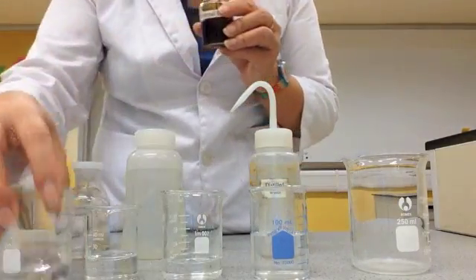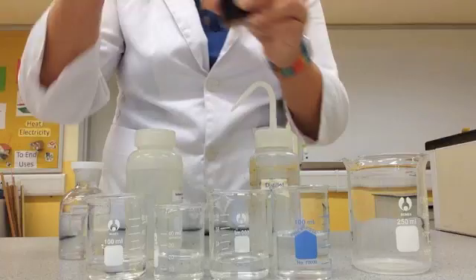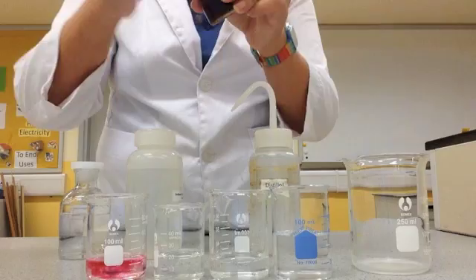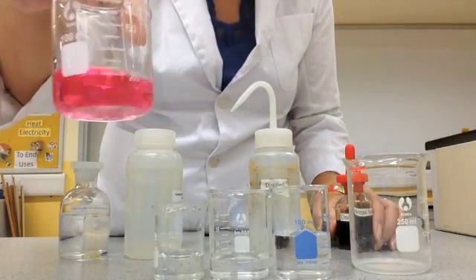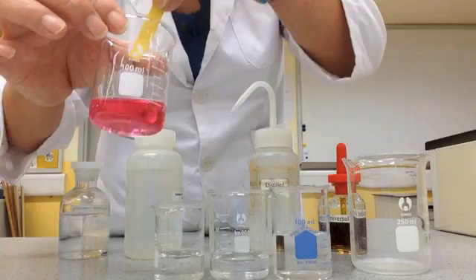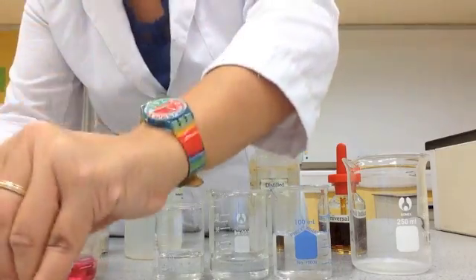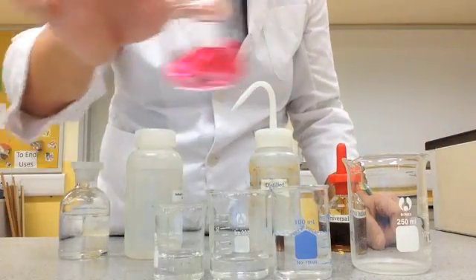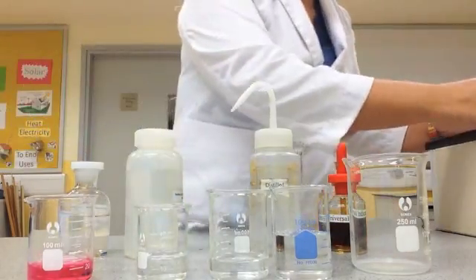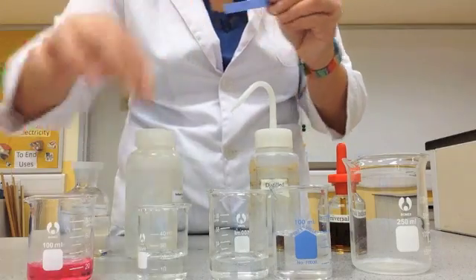Now let's confirm using the liquid universal indicator. The universal indicator turns pink — yes, it is an acid. I also tested it with the yellow paper universal indicator and it turned pink as well. So this one is definitely an acid.